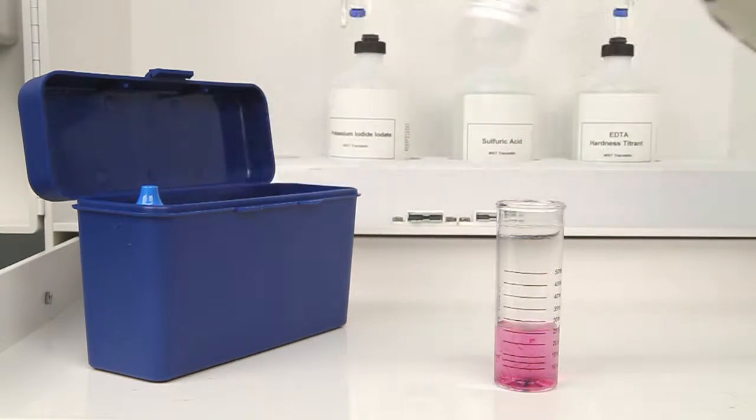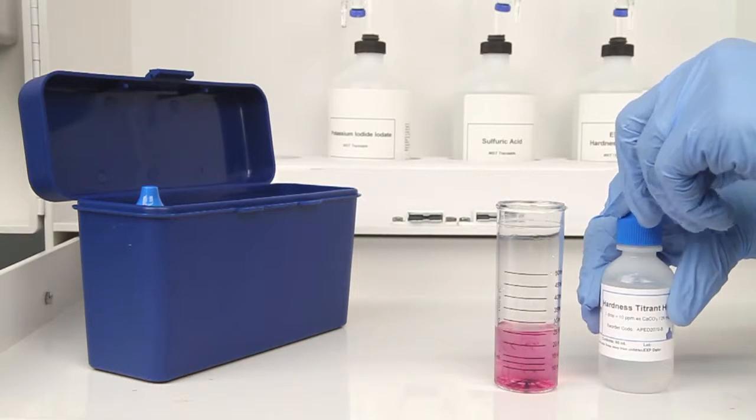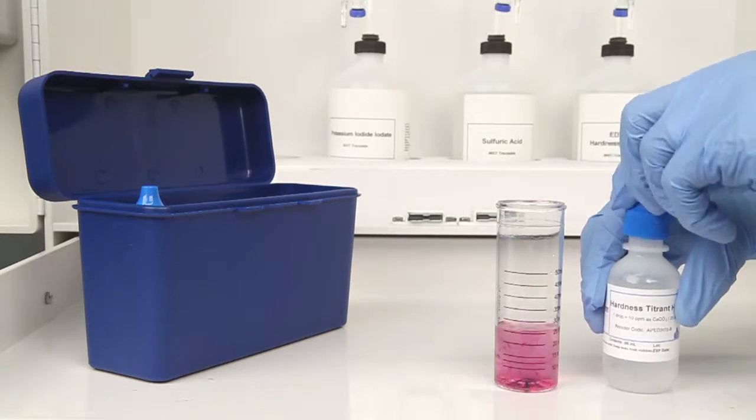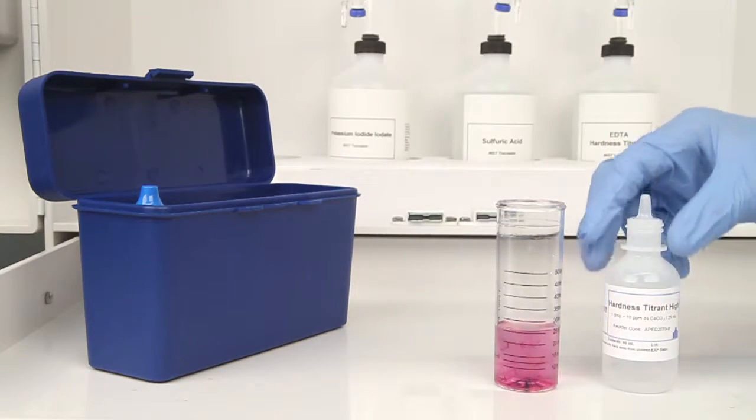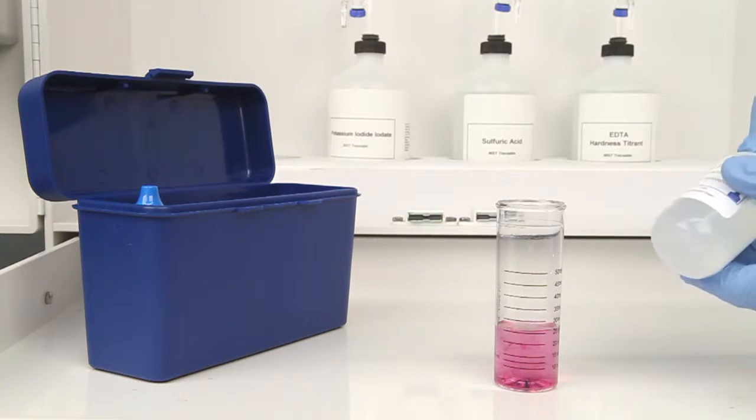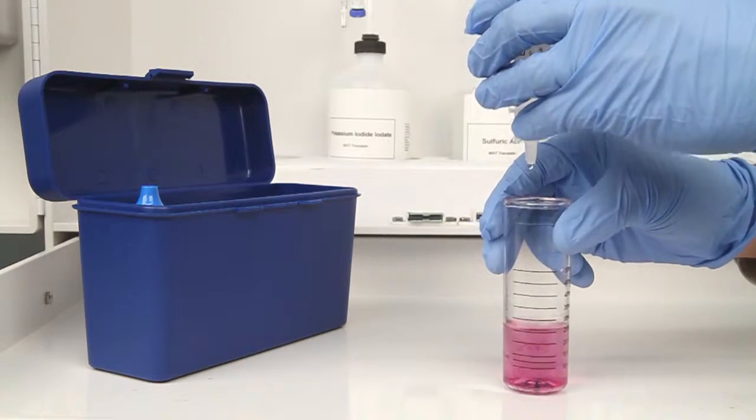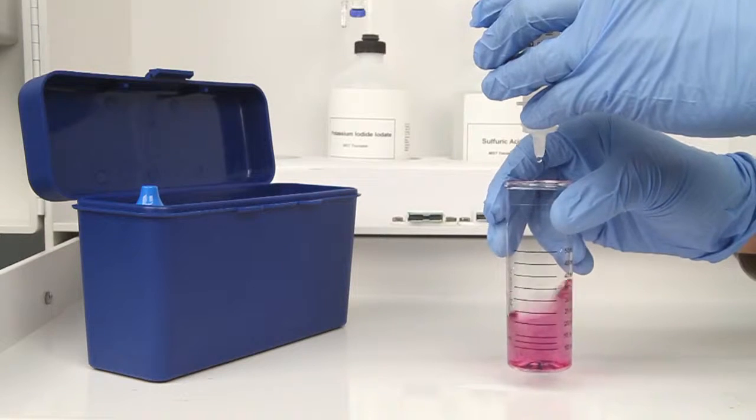The next step is to perform the titration. Each bottle of titrant is labeled with the equivalency and sample size it was manufactured for. It's important to make sure you have the proper titrant and sample size for this titration.